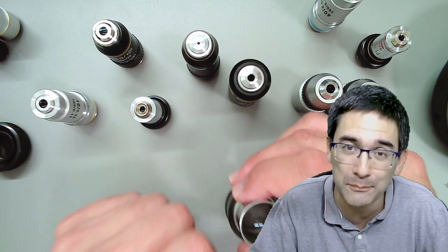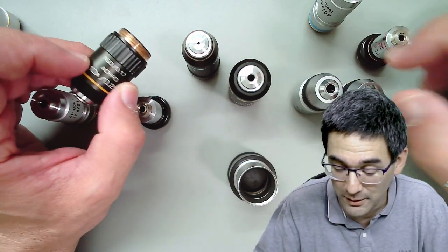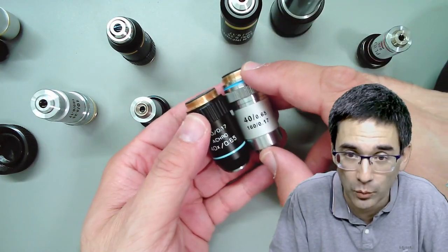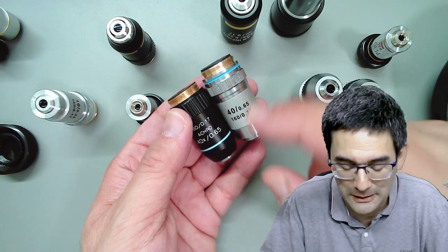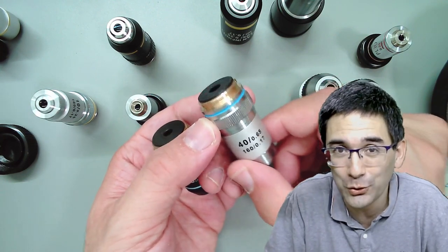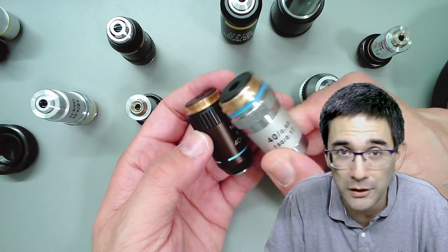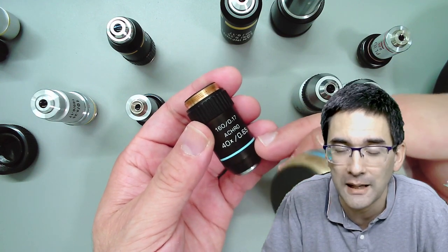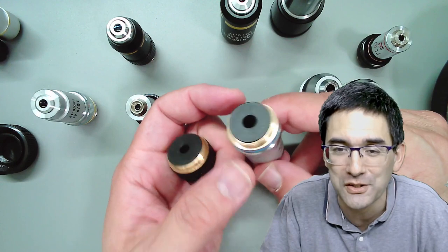Unfortunately you can't tell from the outside which objective has better image quality. Generally, microscopes with silver objectives are cheaper and not quite as crisp and clear as the black ones, but you'd only notice the difference in a side-by-side comparison - they're still pretty okay. The more expensive microscopes tend to have the black ones. Some people need that improvement, especially for a lot of photography work, and then you have to invest in more expensive objectives.